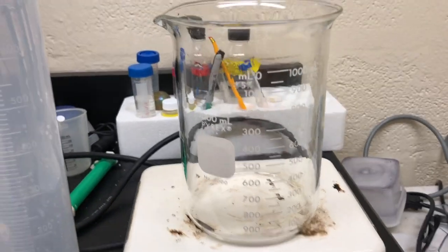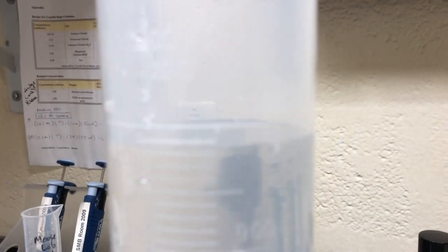So once everything has dissolved, you pour that solution back into the graduated cylinder and you see that it hasn't reached a thousand yet.